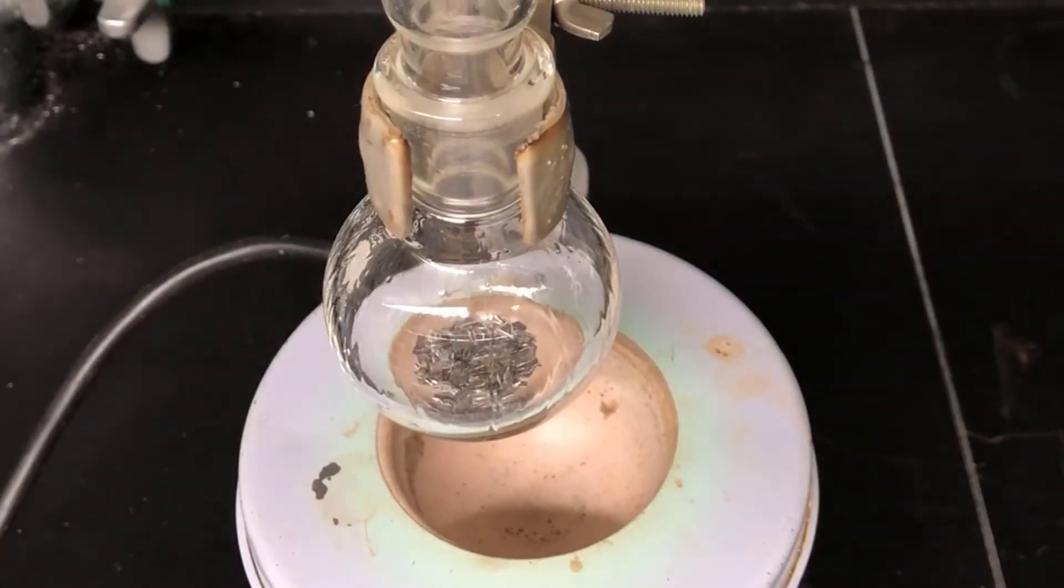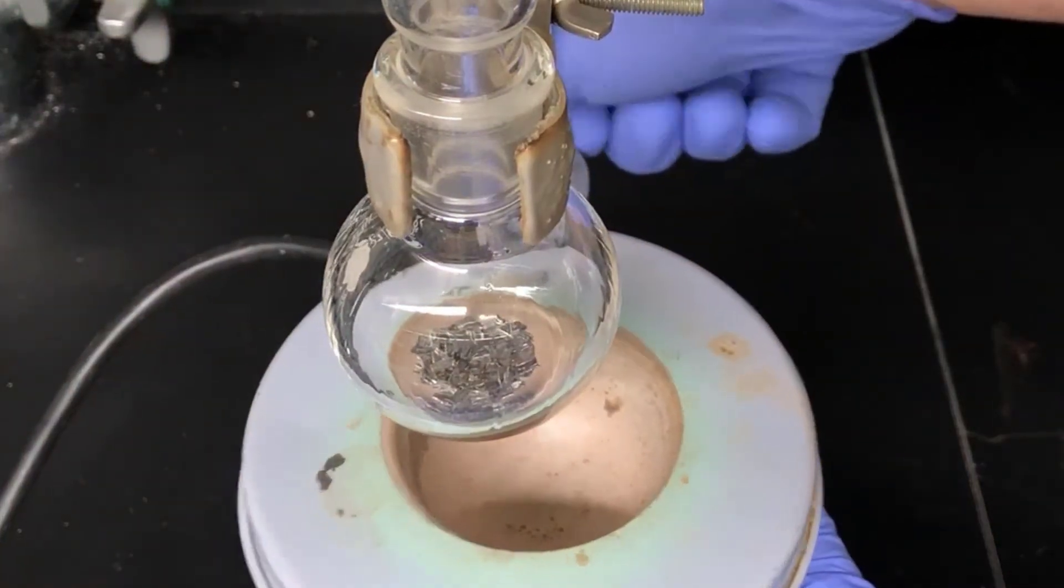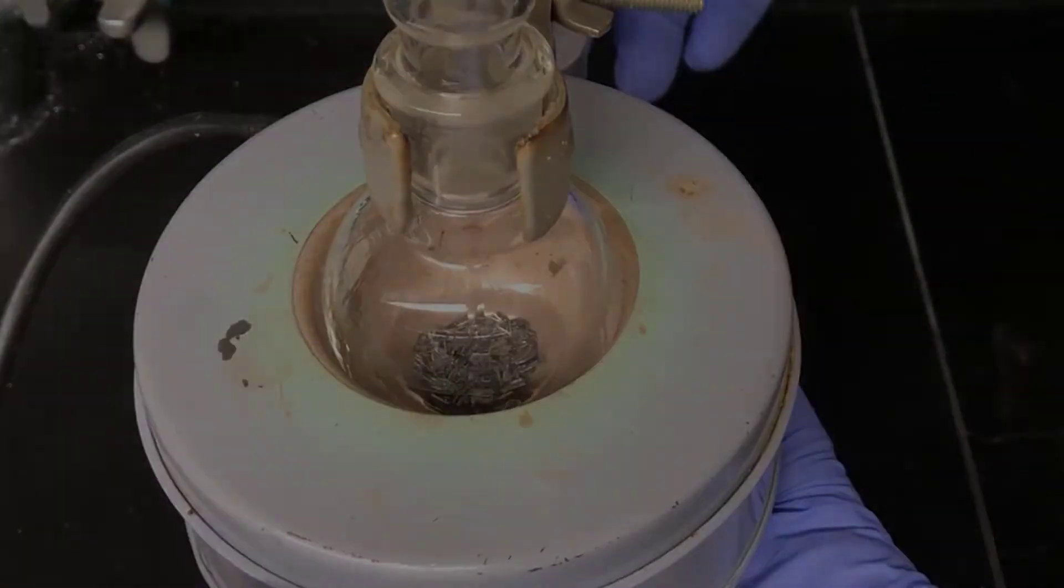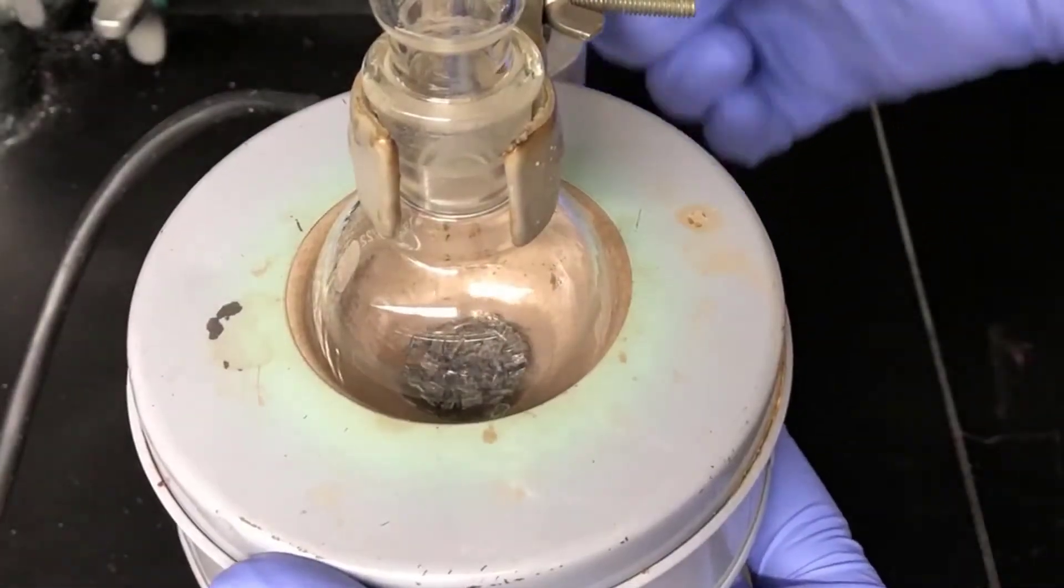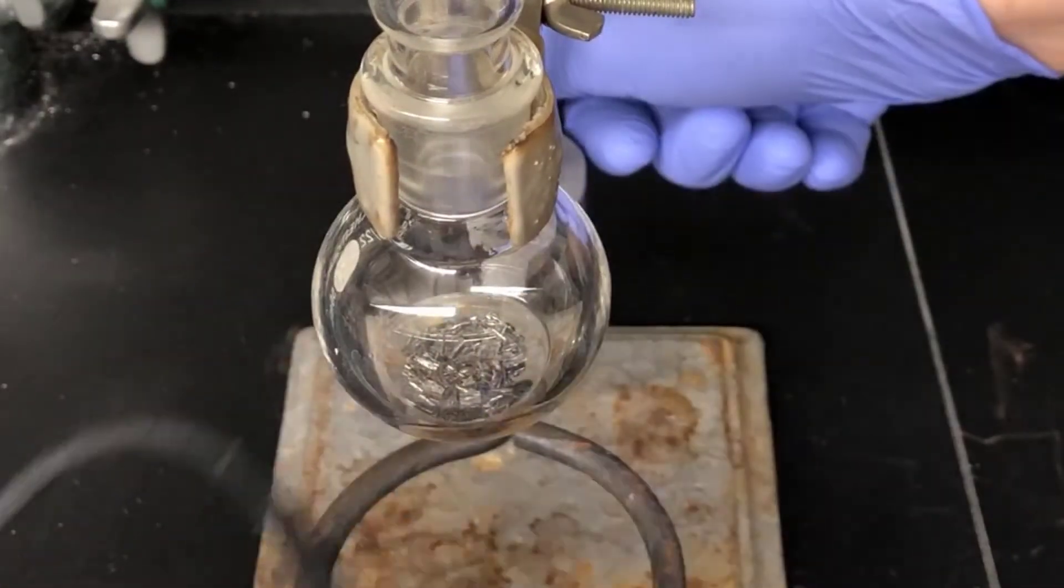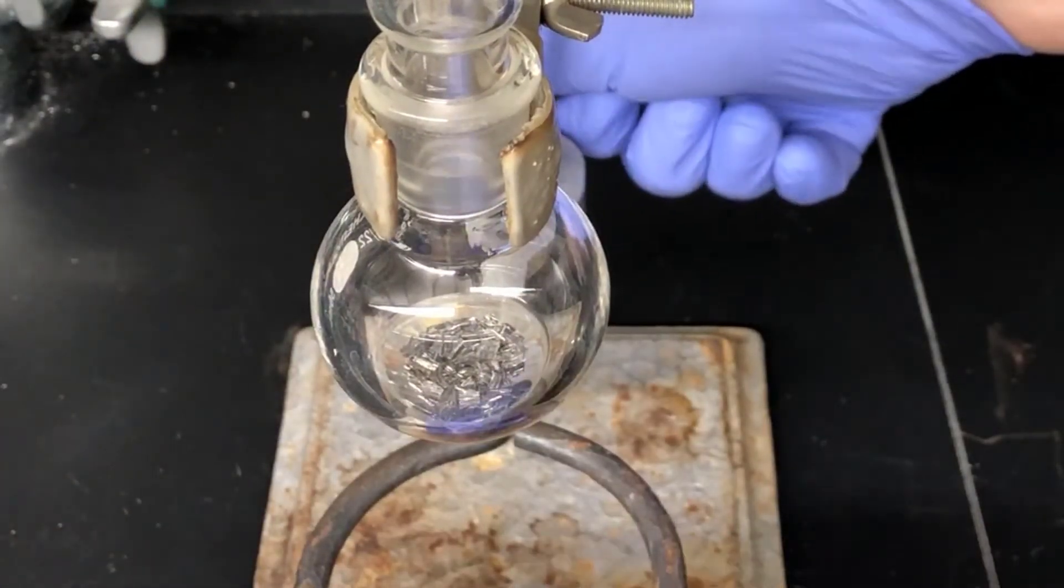I'm not seeing any evidence here that the Grignard formation reaction has started, so I'm going to resume heating for a bit longer. I've been heating the reaction for at least five minutes now and I still don't see any evidence that the Grignard reagent is forming.